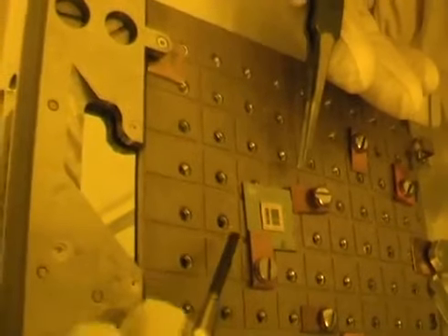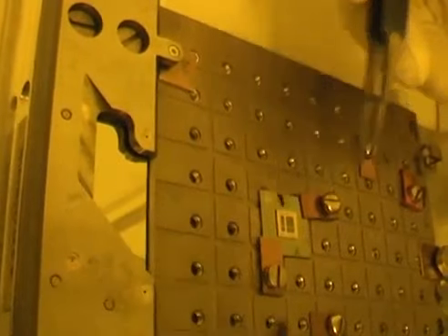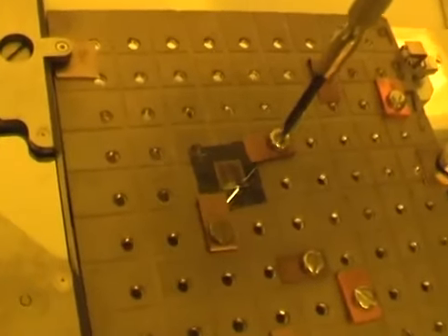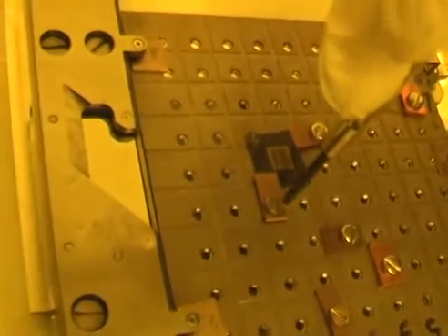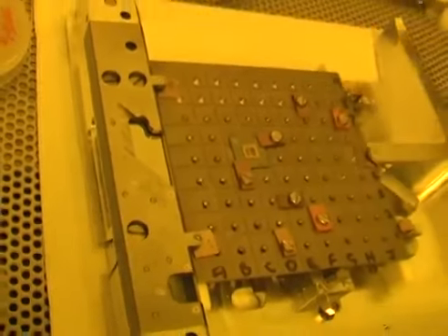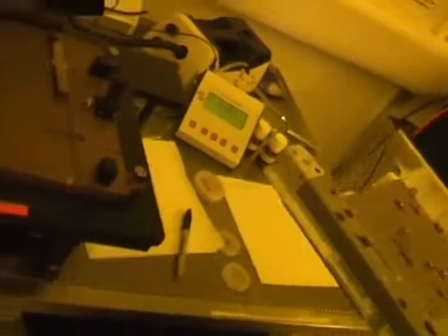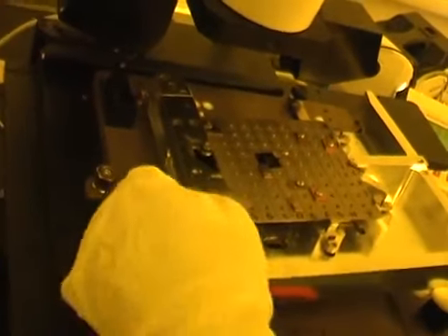Sorry, this is awkward. There we are. So it's now two clamps which are effectively on opposite corners. Okay. Now let's try the height again. I suspect that might have improved the tilt, but it won't help with the height offset.